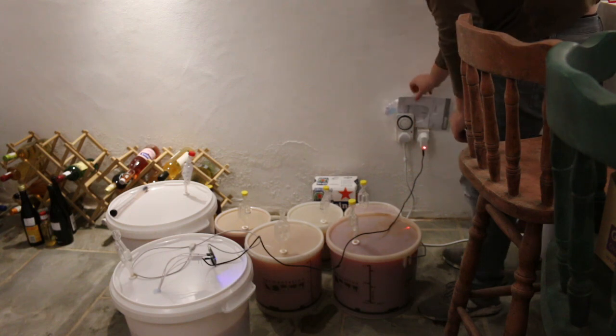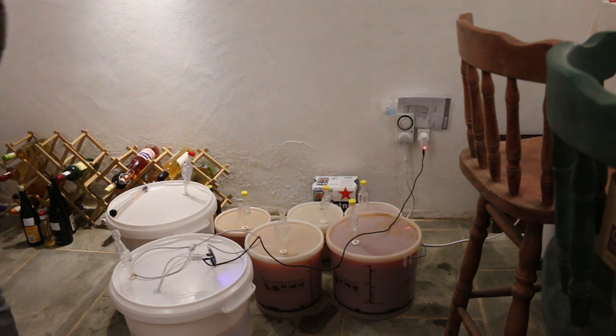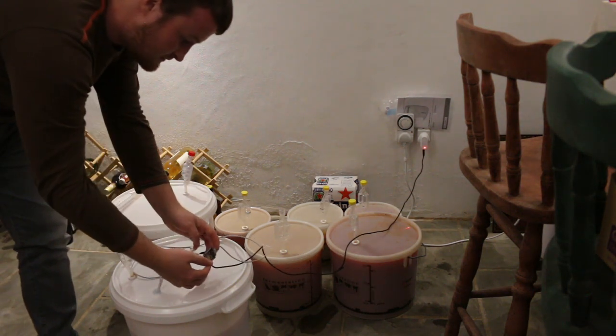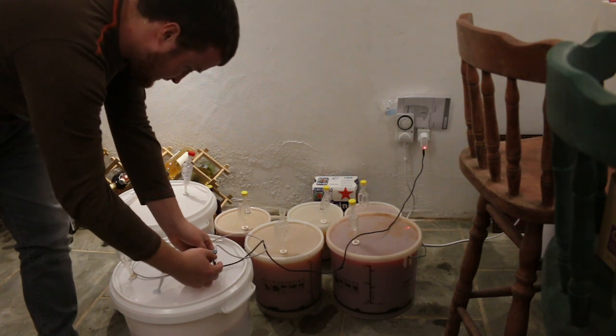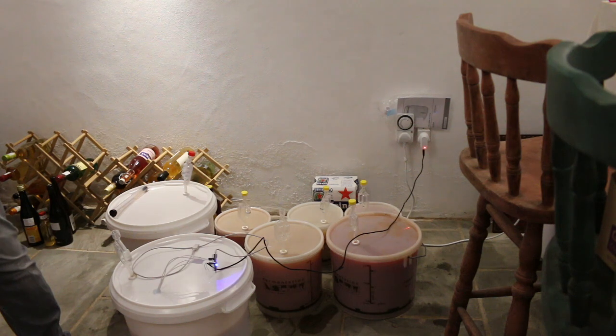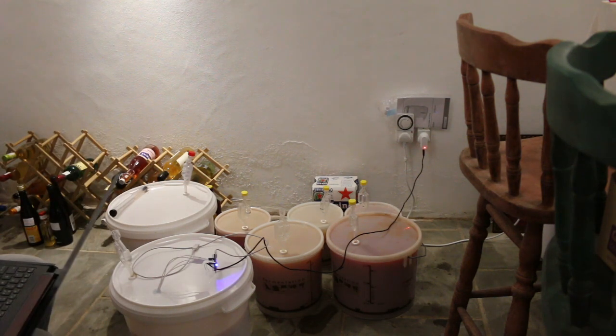Perfect, alright. So you can see here, the blue light is flashing, or is on, which means it's running. Don't want to move that too much, obviously these connections aren't very solid. Not the best at creating DuPont connections, I realised the other day.